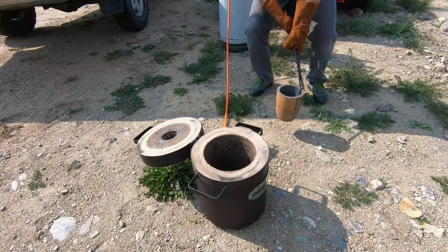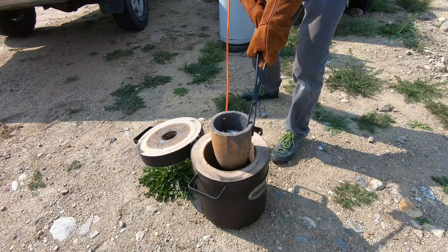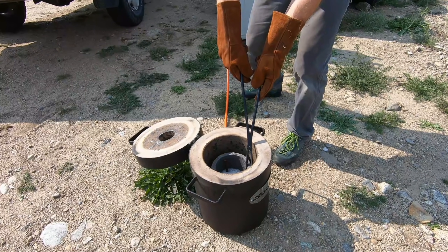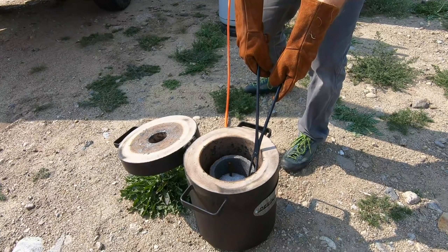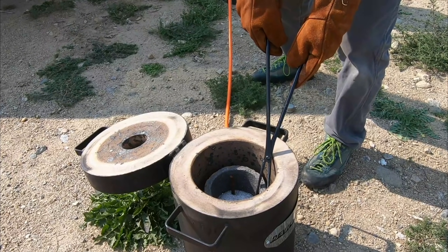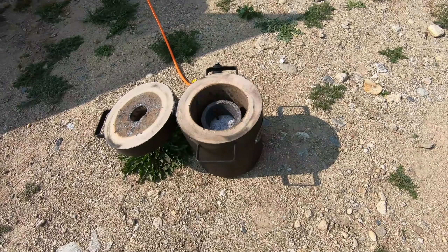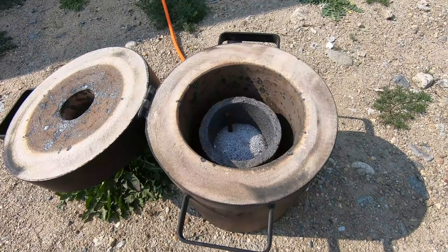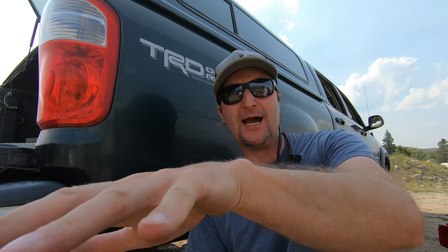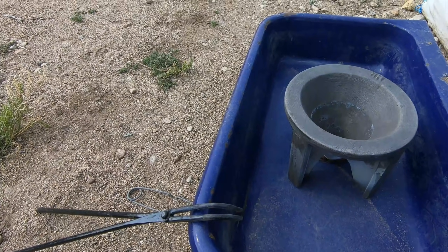All right, here she comes — it's pretty warm, nice and centered. Since this charge in the crucible has a whole lot of soda ash in it, I'm gonna bring up the temperature in the furnace slowly so the soda ash doesn't boil and froth up over the edge. So we're slowly ramping up the temperature on the furnace.